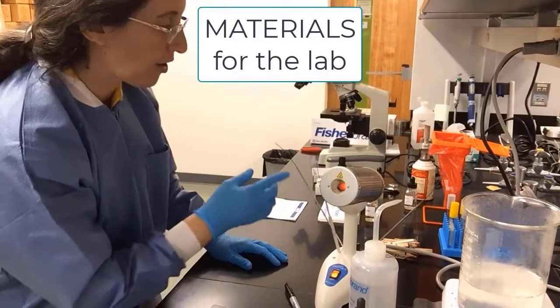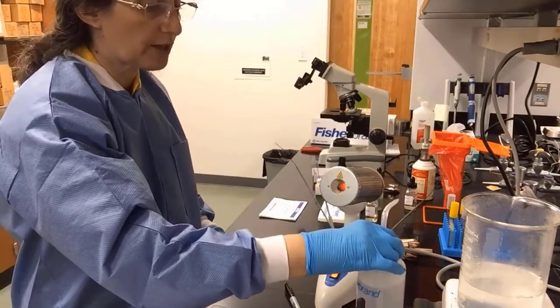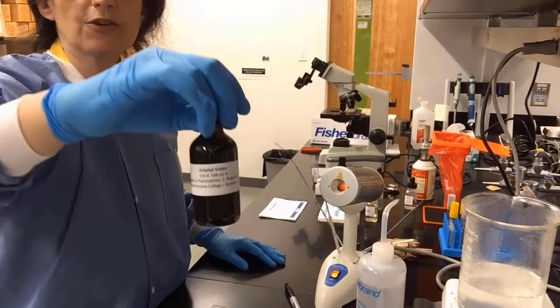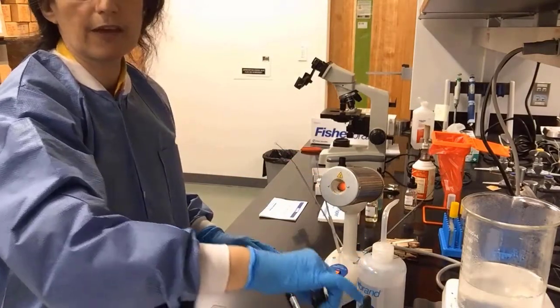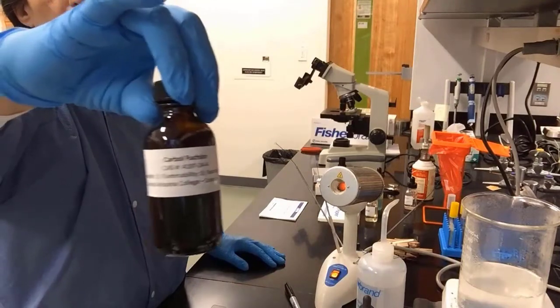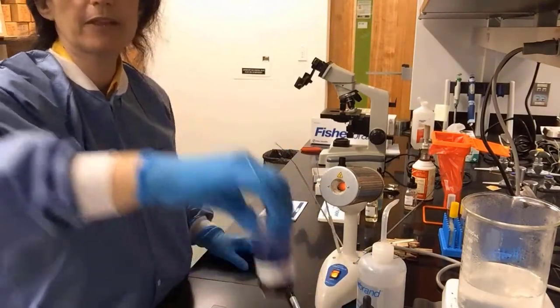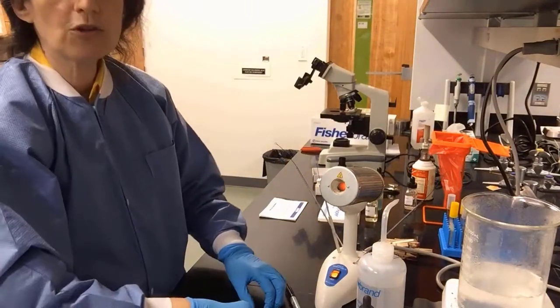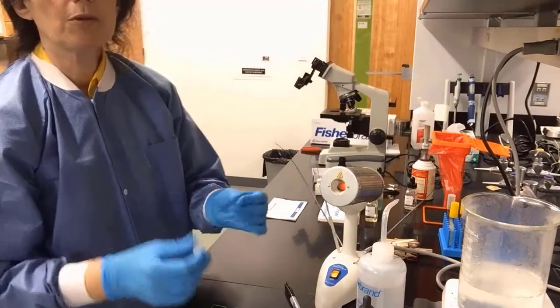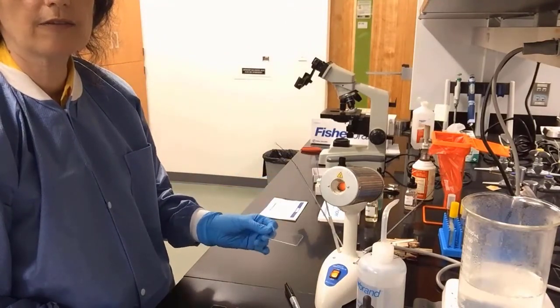Let's move on to the materials. We have the bacinerator and our loops, the distilled water. We will use some stains. Here's crystal violet, a violet color. Here's carbolfuchsin, a deep red color. And here's methylene blue, blue color. They're all simple stains. We also will use the regular microscope slides that you can see here.